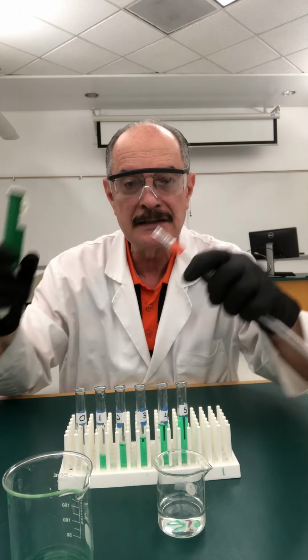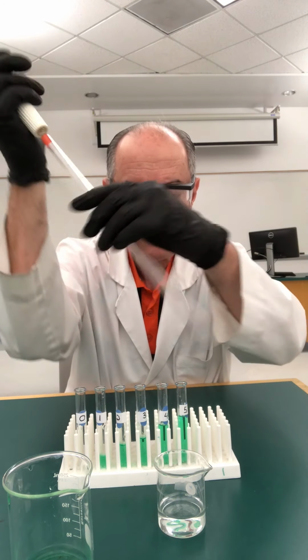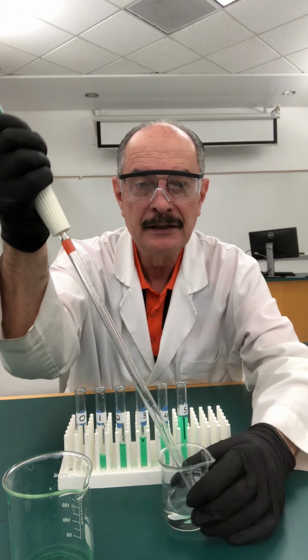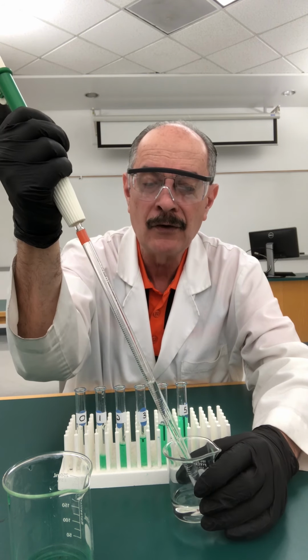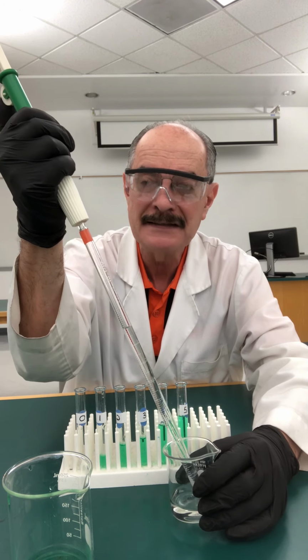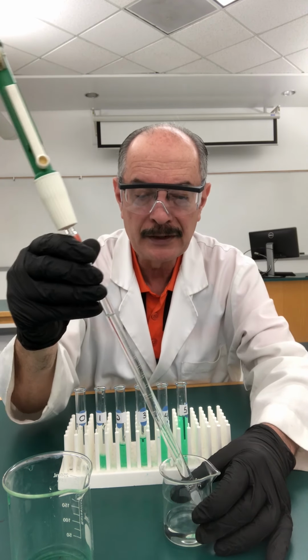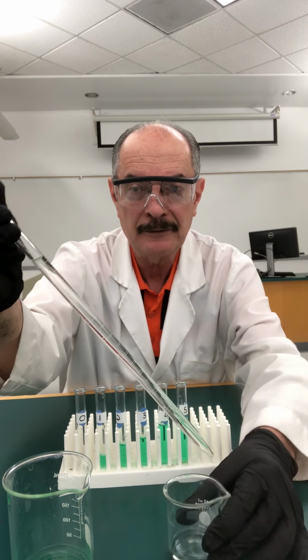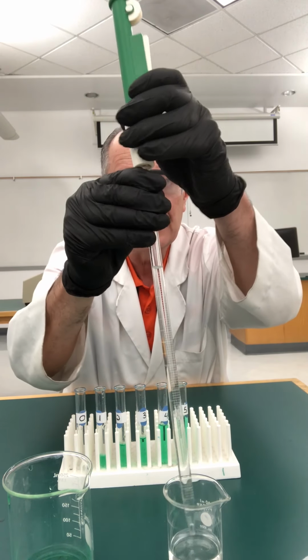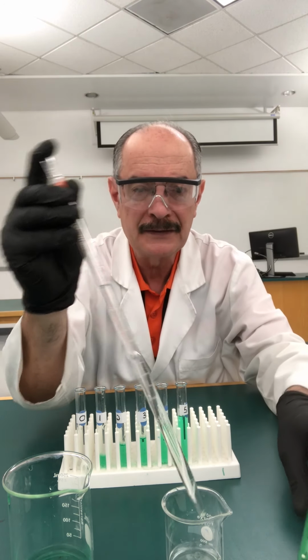Once more, you're going to take your pipette, attach the adapter, dip it in the water, and suction the water that you're going to need. I'm going to go all the way up to past the 10 mark, if possible. Again, I pull it out, touch it against the side of the beaker. Very rapidly, I'm going to take this out and put my fingers in there.